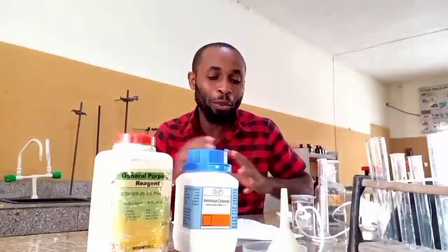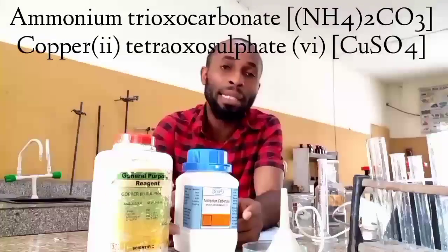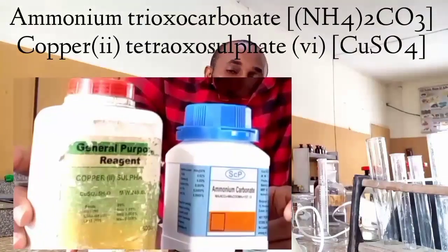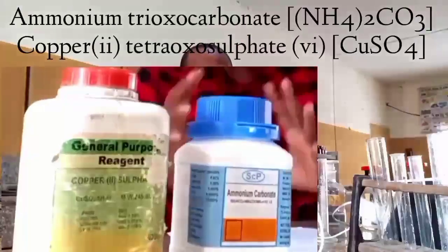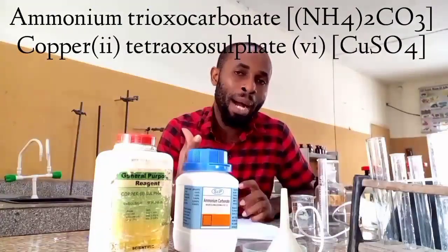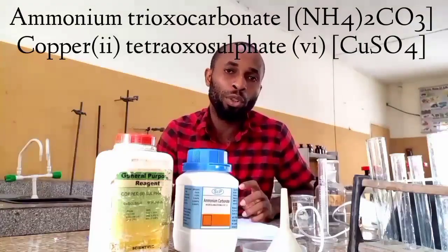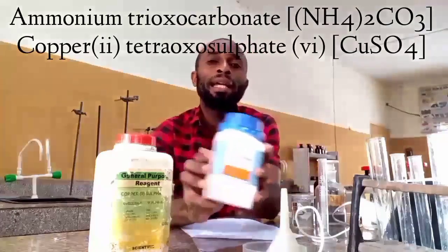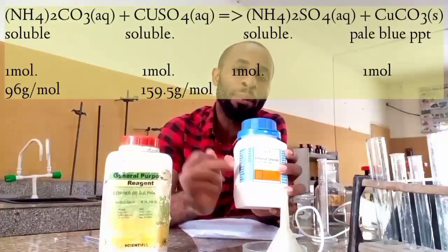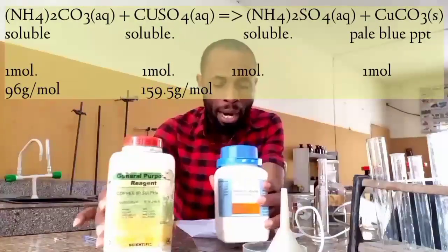According to what WAEC provided for us, they asked us to make use of two salts. One is ammonium carbonate and the other is copper(II) sulfate, and according to the instruction, they asked us to mix these together with equal mass. That is a 1:1 ratio. Now, if the mass here is 1 gram, this should also be 1 gram. If this is 2 grams, this should also be 2 grams.